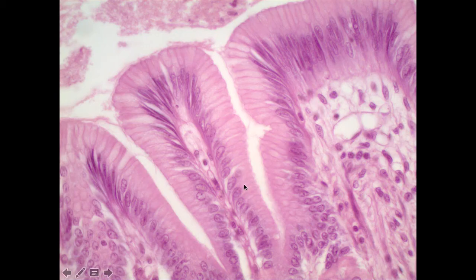It could be the magnification, but we still see a single layer of cells. In this case, it's sort of following a nice little pit here. And the single layer of cells is composed of columnar-shaped cells. Each one of these cells is shaped like a column. It's not square or cuboidal like we saw previously, and it's definitely not flat or squamous like we saw at the beginning. Again, the nuclei seem to be all arranged in a single layer.